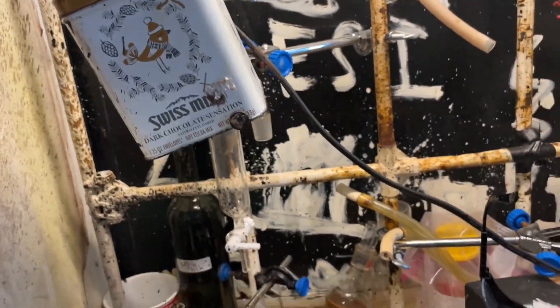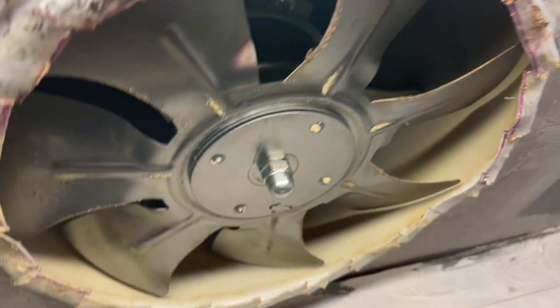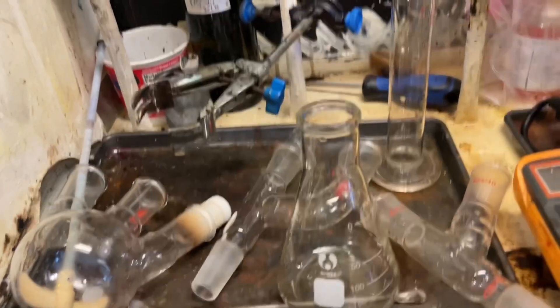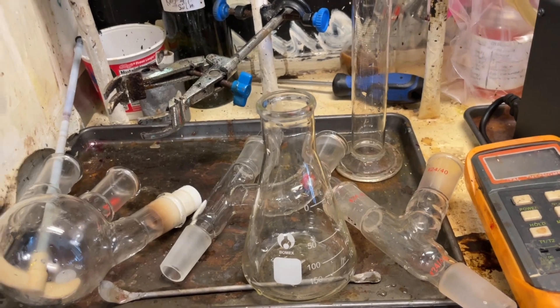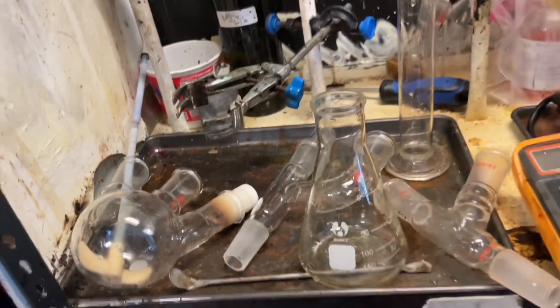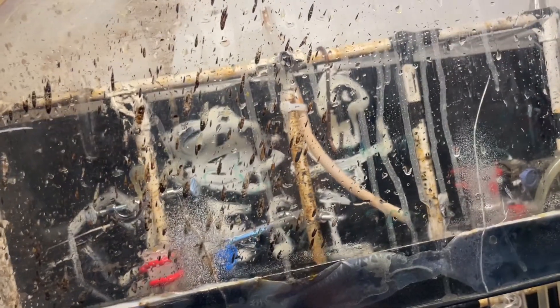Okay, it's the next day. And yeah, I still haven't cleaned all of it up. I mean, it even went on the light. Then, also, it went to the fan, I think. Well, the fan's already coated in sulfur from the sulfur chloride, because that's the hydrolyze and wet air. Okay, there we go. Glassware's all cleaned up. I ran out of sodium metabisulfite, so I found if you put vitamin C in it with a bit of hydrochloric acid to spice it up, it works really well to clean off manganese dioxide. Very effective. However, yeah, I'm too lazy to clean up the sash. And also, it already has stains from acetic acid explosion anyways, so I don't really mind. It's not like I look through the sash often.